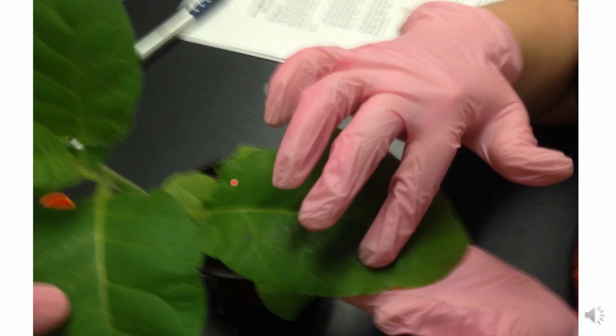The only difference between the control plant and the experimental plant is that on the control plant you just rub a solution which contains the buffer and the abrasive material, while for the experimental plant you rub a solution which must contain the buffer, the abrasive material, as well as the actual infected sap, so that if the virus is present, it would show the symptom on the indicator plant. While in the case of the control plant, only the injury caused by the abrasive material can be observable.